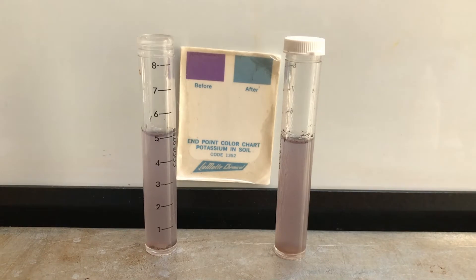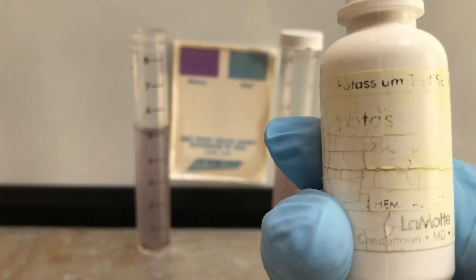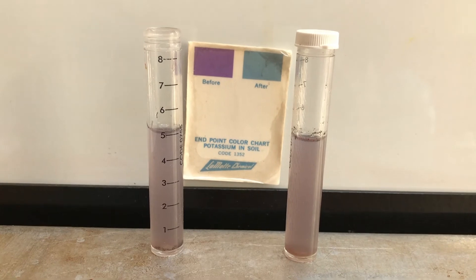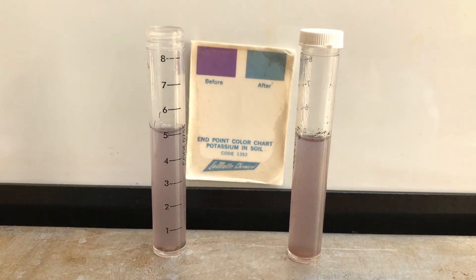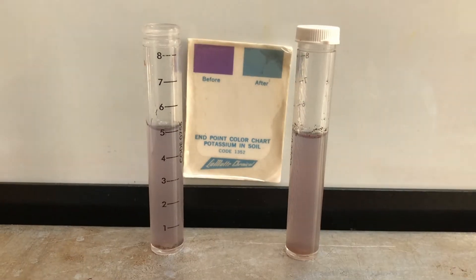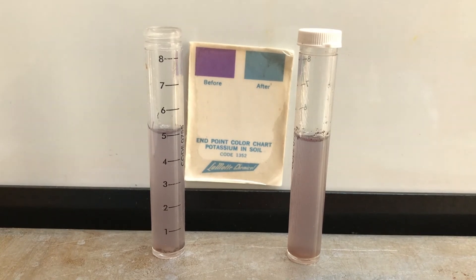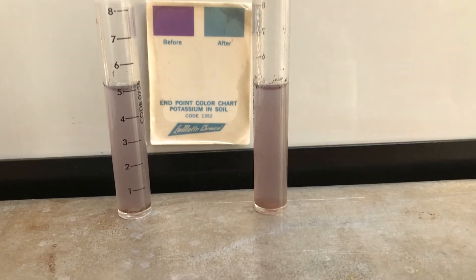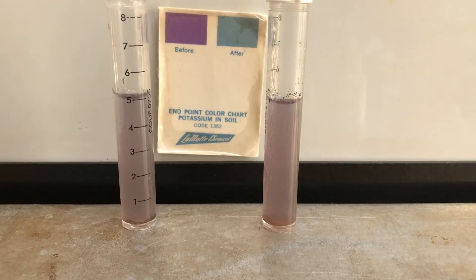Now to do this, we need to add in succession drops of potassium indicator solution. What should happen is after we add the solution, we're going to shake the vial. If it turns completely blue, we know we've reached the level and need to stop adding the solution. If it changes completely blue between 1 and 10 drops, we know we have a high level. If it's between 10 and 20 drops, it's a medium level. And if it's 20 drops or more, it's a low level.